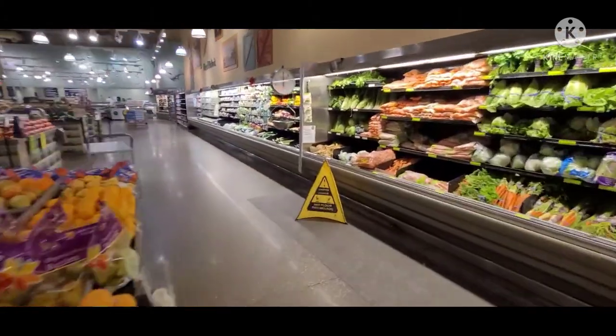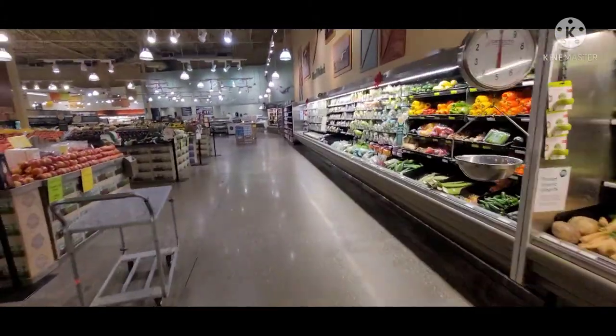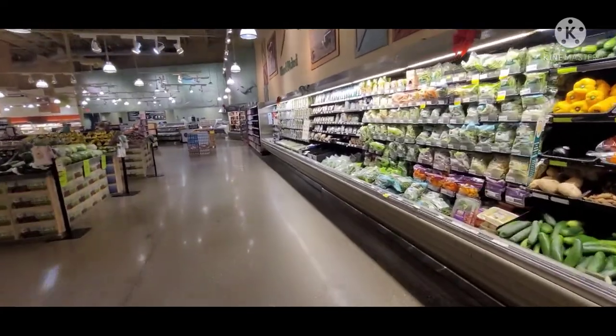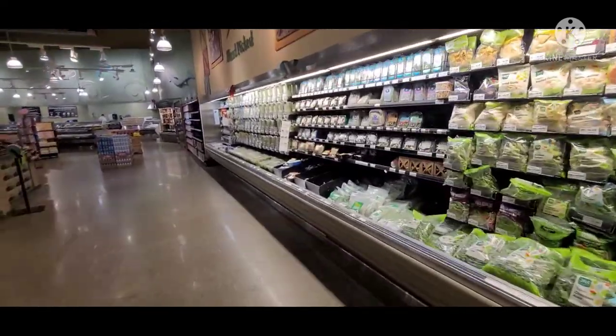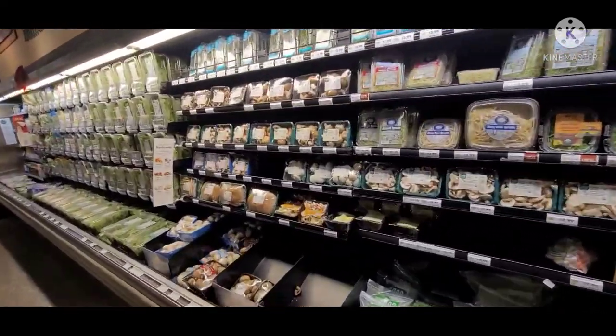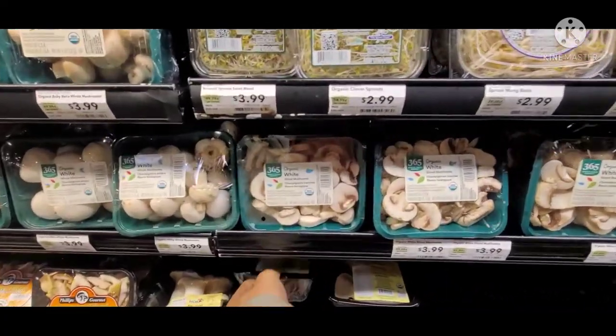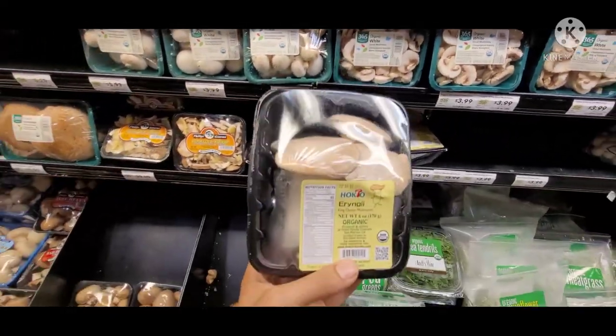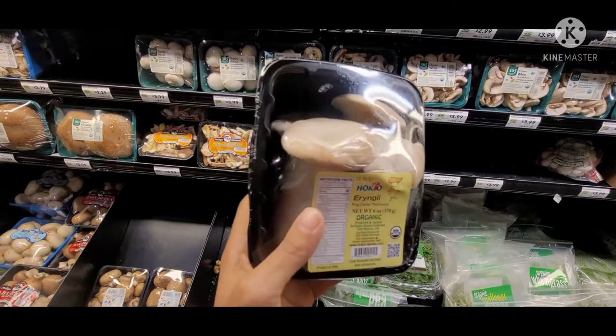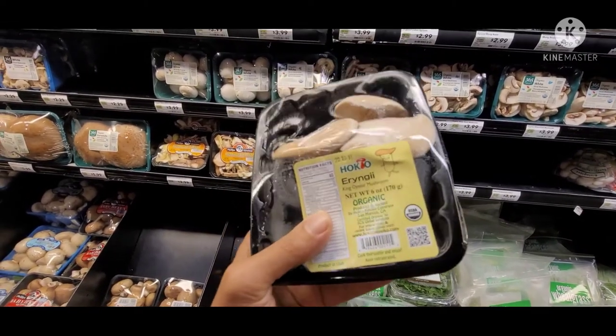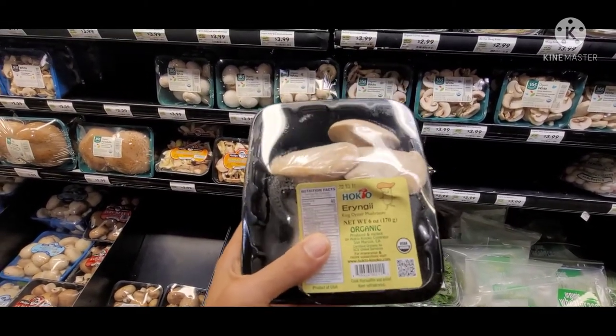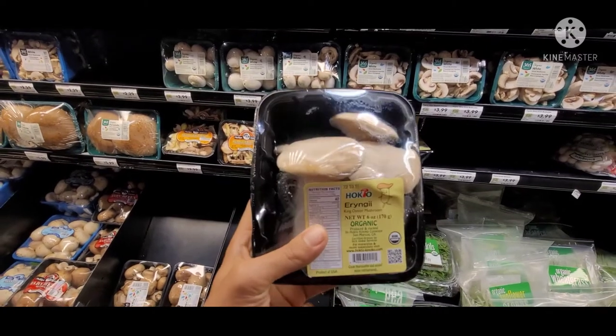Hey guys, Brandon here. I see fungi. What the heck is a mushroom forager and grower doing in the store buying mushrooms? I'm gonna show you guys a little trick. Let's take these king oysters, one that I don't have in my collection. We're gonna take these home, clone them, and put them on agar.